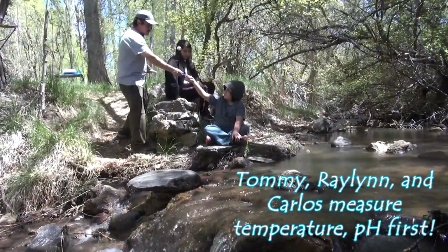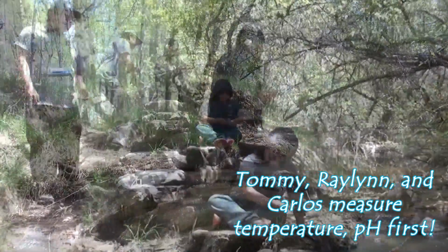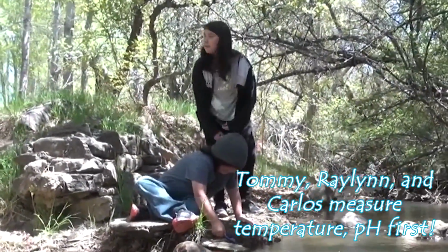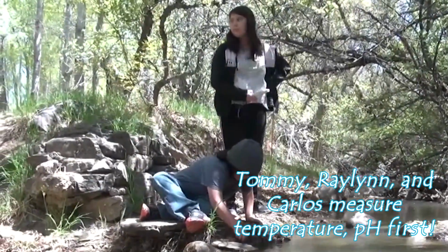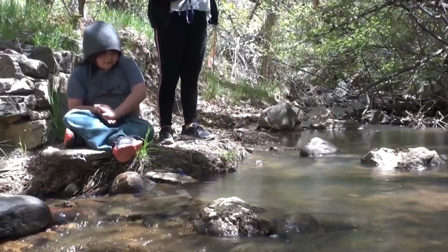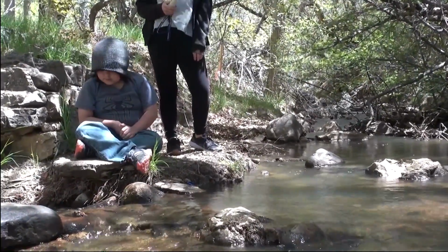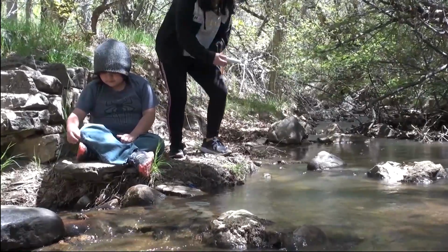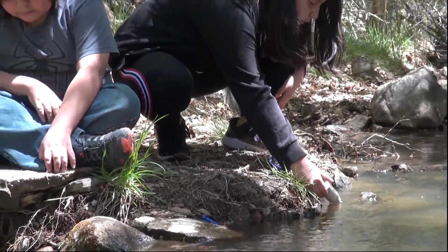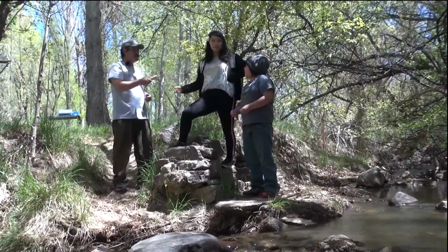Tommy, you're going to take temperature. Raylyn, you are going to measure pH. As Tommy's measuring temperature, he's measuring in degrees Celsius, which is the standard unit utilized around the world. Raylyn is going to be measuring pH. pH is a measure of how much acid or base is within the water. It's probably a 7.3. I got 7.3 pH. I got 12 degrees Celsius.